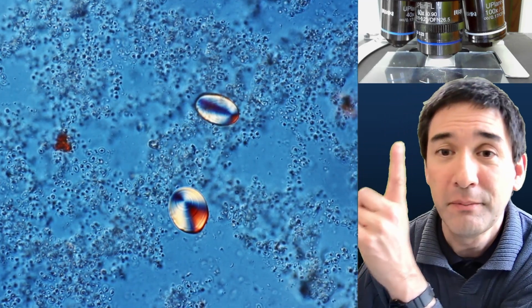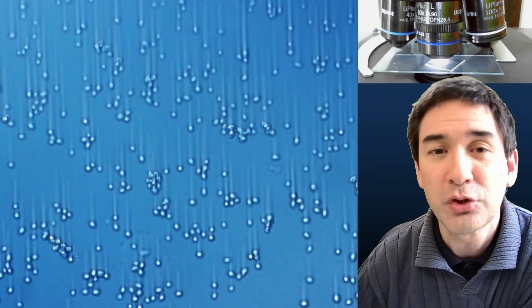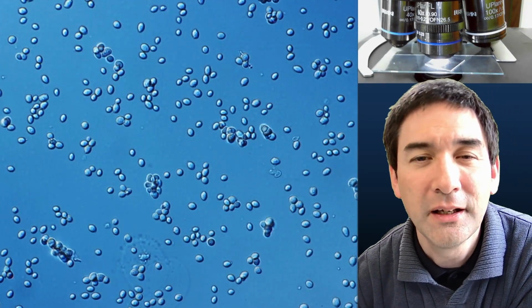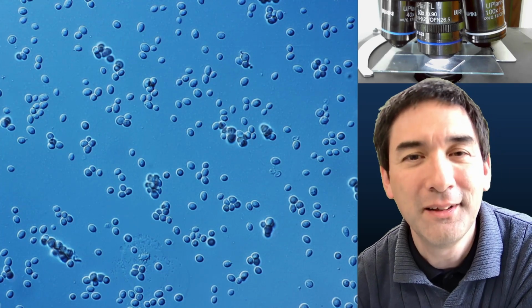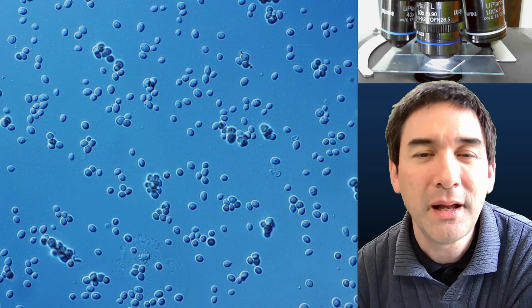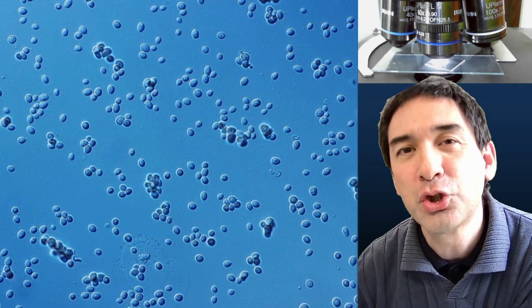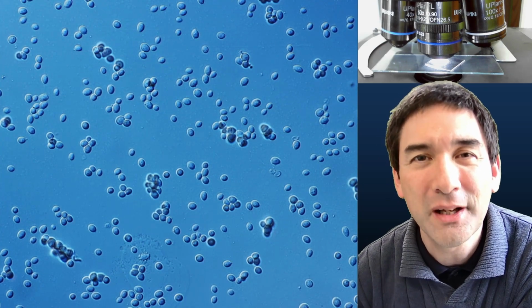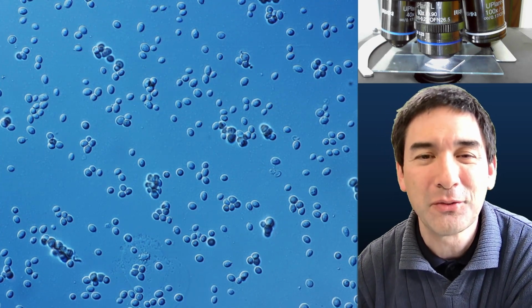I also put them up on my microscope stage here. And this is how fresh yeast cells look. Much more defined in their shape, and of course, much larger than what we just saw before. And those yeast cells, if I were to add sugar now, they would start respiring, and they would also start to form carbon dioxide bubbles, which you could also see under the microscope.